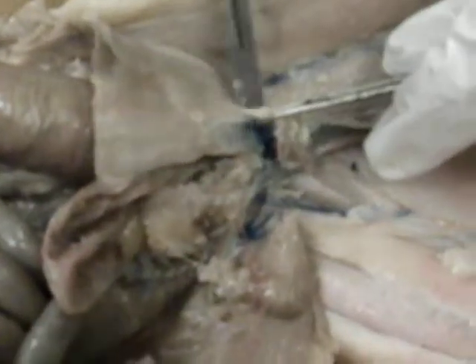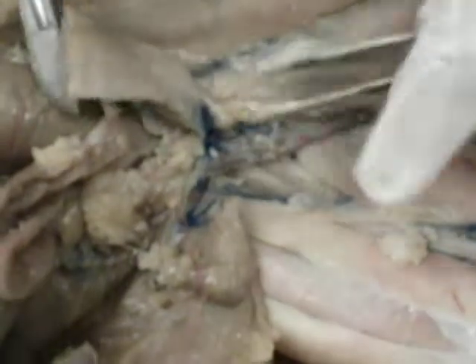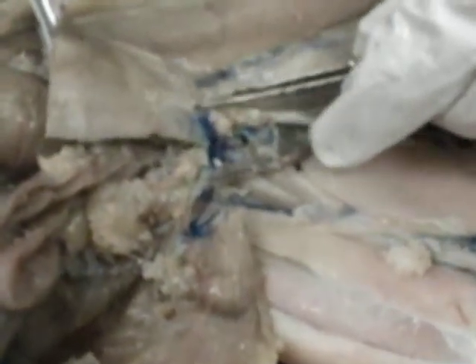Now, where it went through the abdominal wall, if you push that back over, there was a hole that this should go through, an opening. That's the inguinal canal. There's one over here too. So the inguinal hernia is when that weakens and the intestines start to push out from that hole. Women can have that too. Pregnancy kind of makes that happen more often. But anyway, there would be a stick or something through that that says opening on the card.